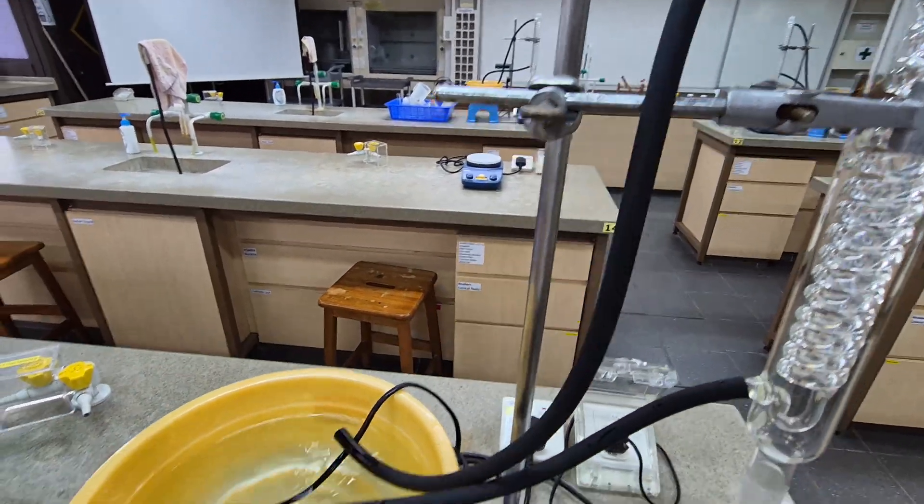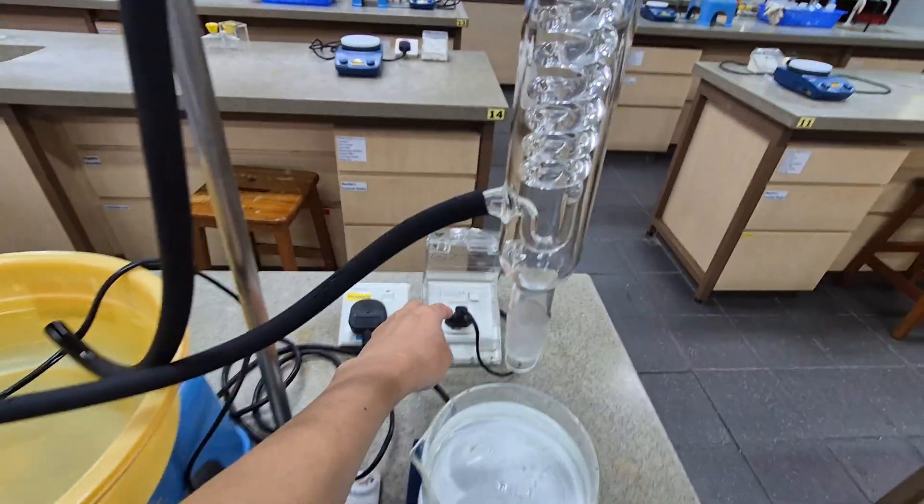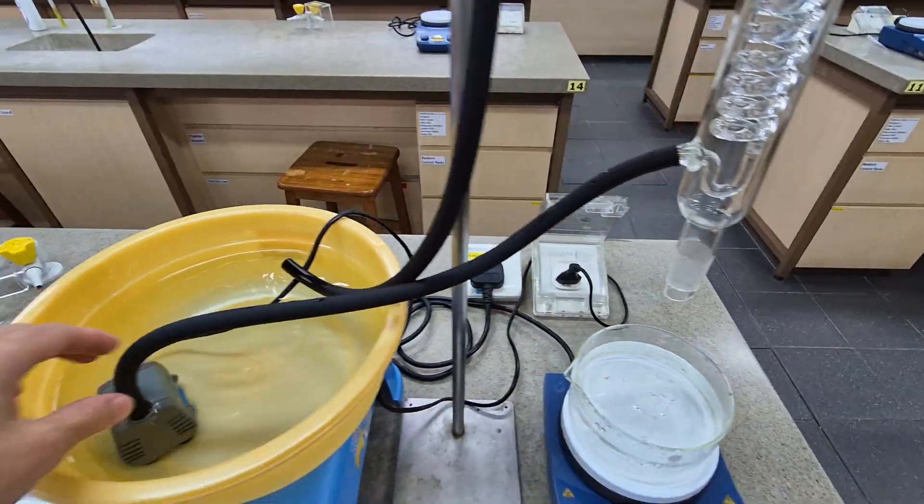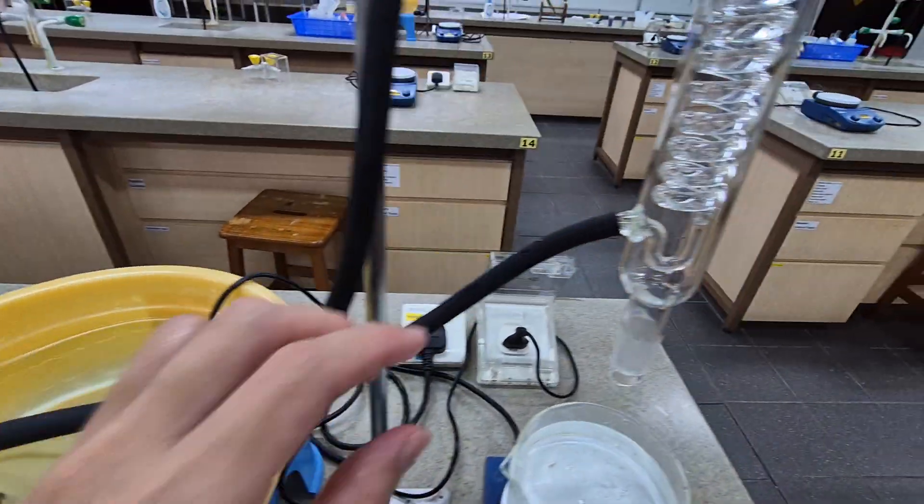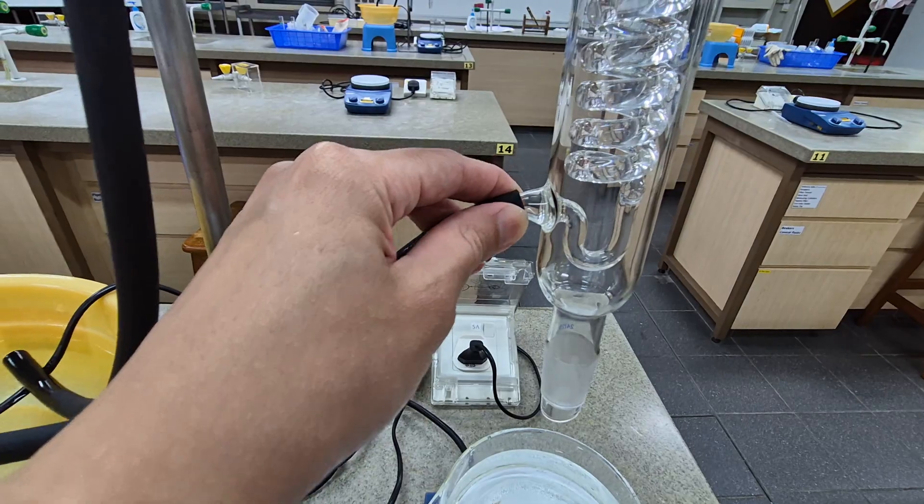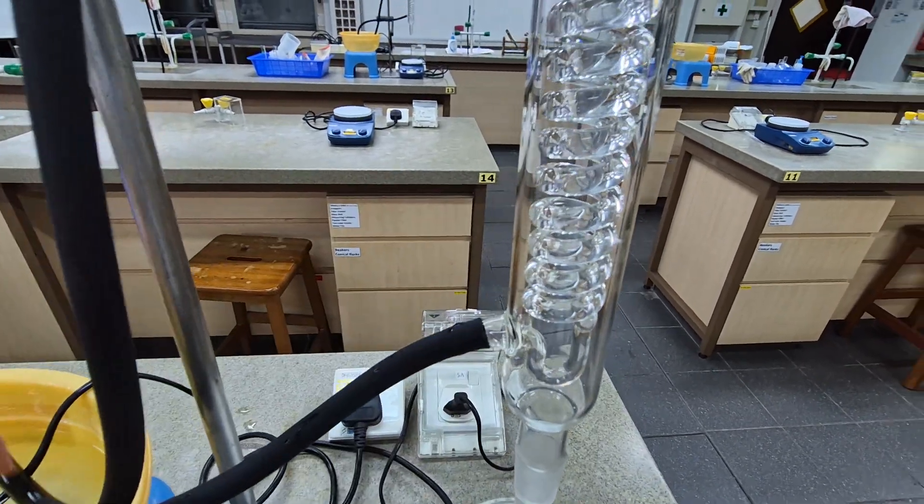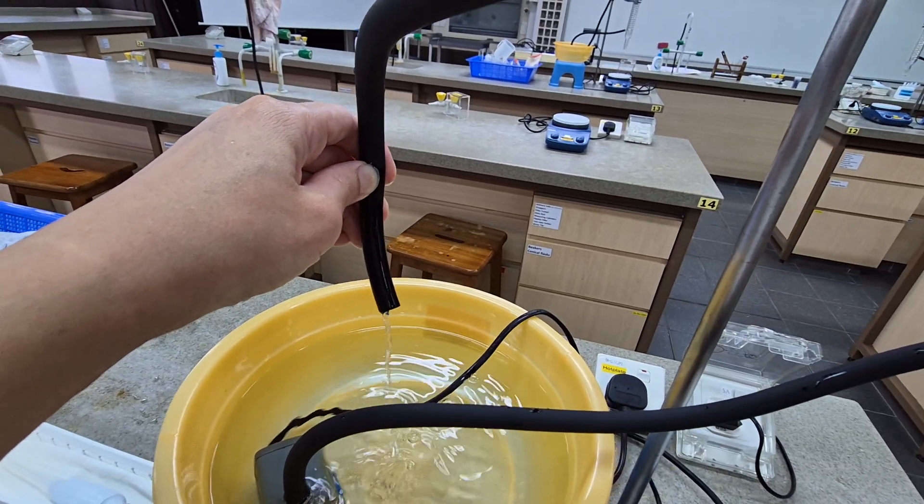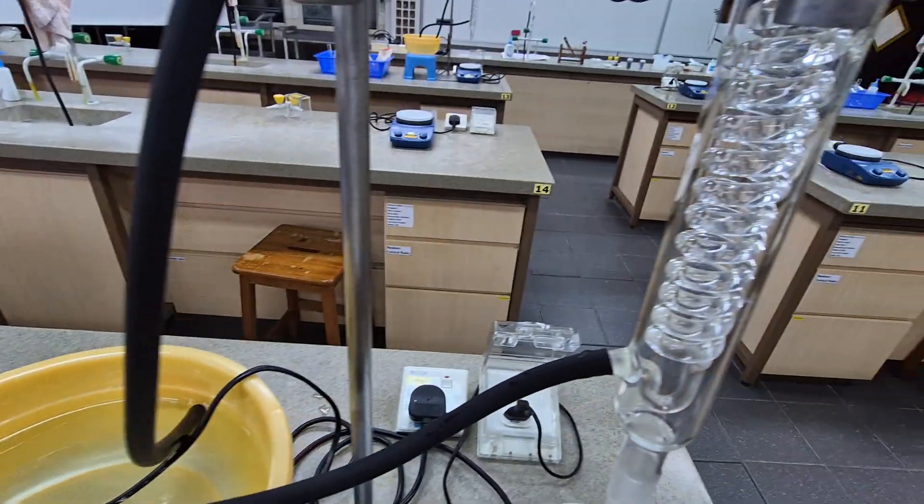I'll just switch it on first. You can see the pump is moving and then the water is slowly moving in. You can see that the water is flowing up. I'm going to switch off the pump first because I don't really need it.